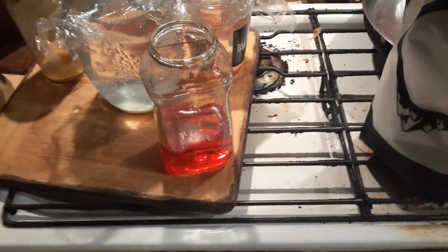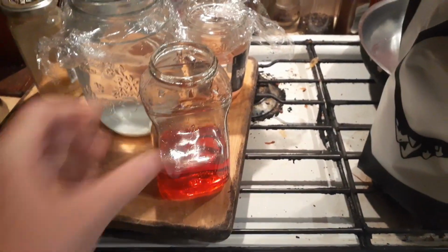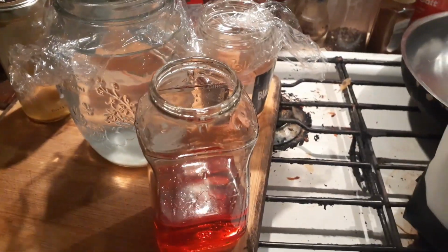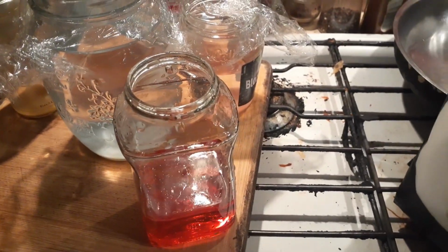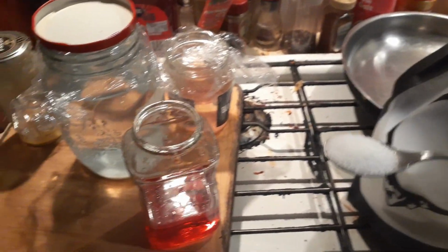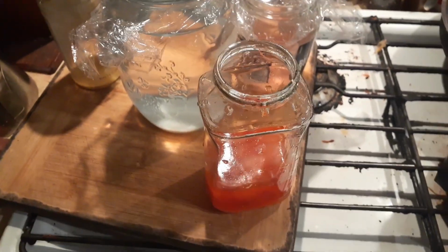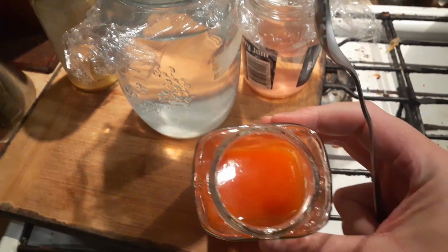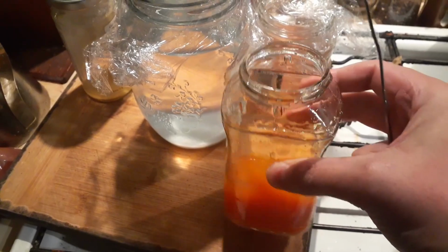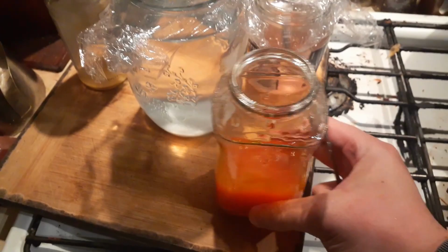Okay, here you can see there's a little more liquid because I added some to it, but it's still the liquid and it has no metal. And now what we want to do is slowly add the hydroxide until it changes its color. So you can see here, spoonful, and you want to do this slowly because it gets hot. Add it in. You can see it's starting to react. And it gets hot, so you've got to be careful with the glass.